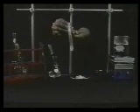If the solid does not dissolve, place the test tube in a hot water bath with a temperature at the boiling point of the test solvent. If the solid remains, then this solvent also is not suitable. Repeat this process once more with another solvent.